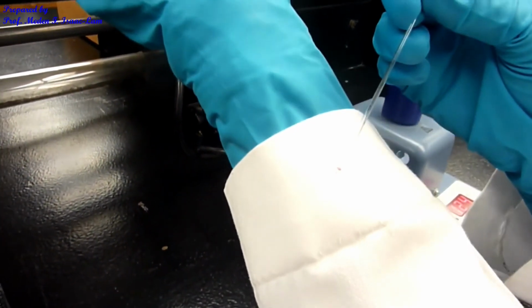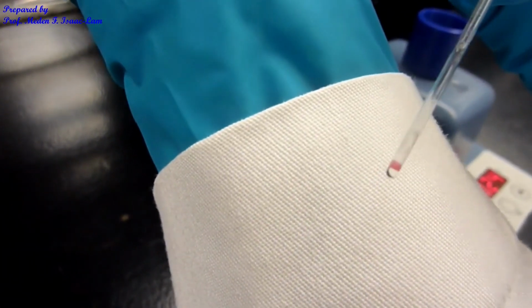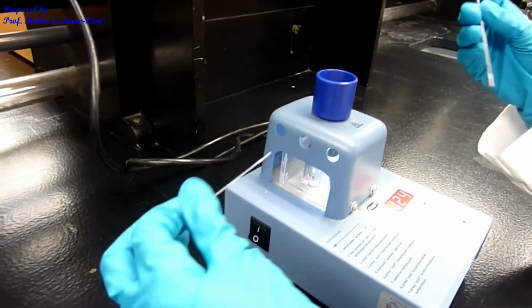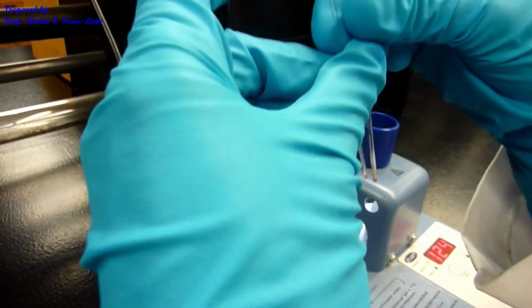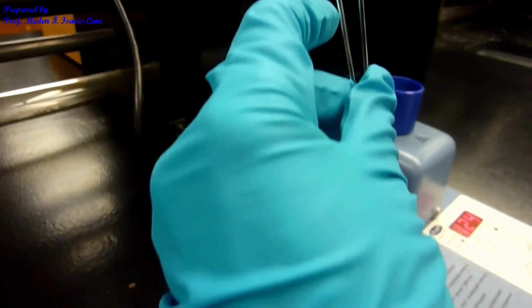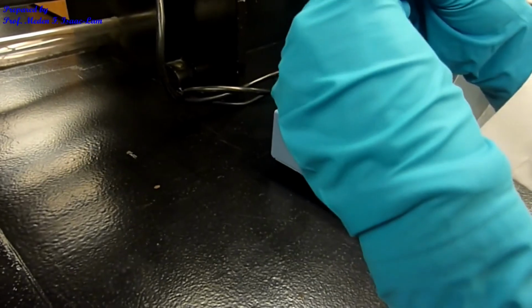All right, you can see the pink color in my lab coat. Okay, so it's starting to solidify again, but this one, yeah, it started to solidify too. Okay, so the unknown A, the one that I labeled with the black pen, actually became pink. All right, so I'm gonna turn this off, stop, turn off. So that's it for this experiment.